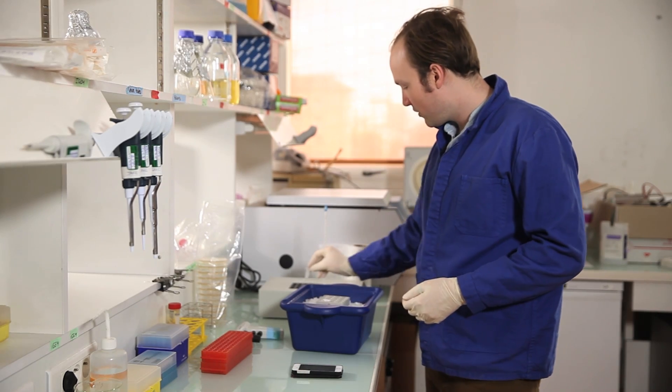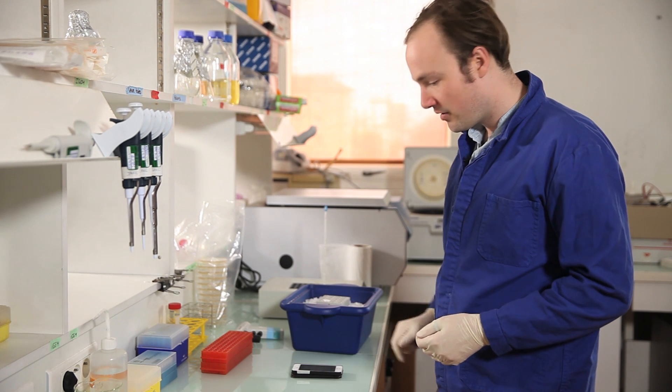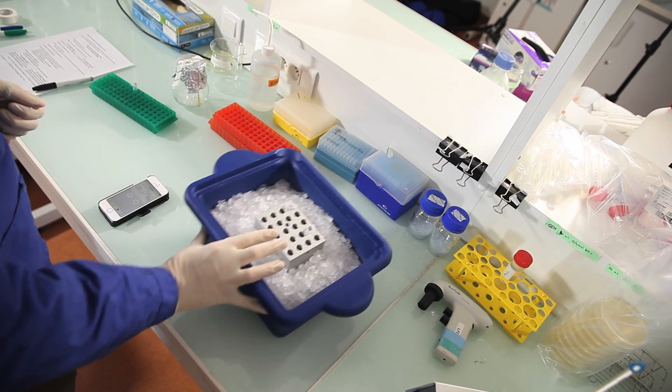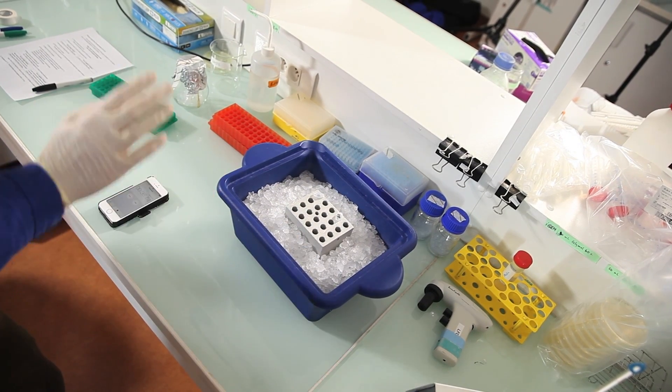Okay. So, boom, 30 seconds on the heat block. All right. That's 30 seconds. Now we take it out, go immediately back to the ice and we'll leave it two minutes on the ice to recover.